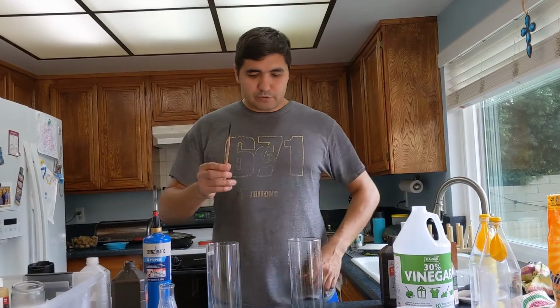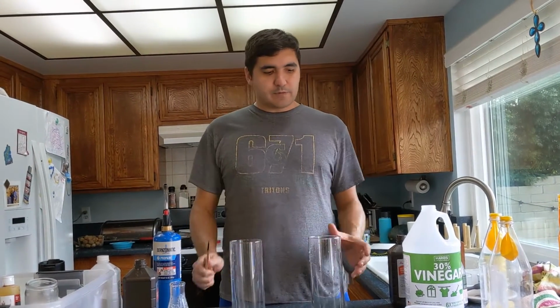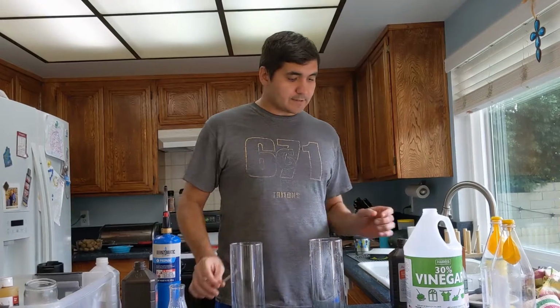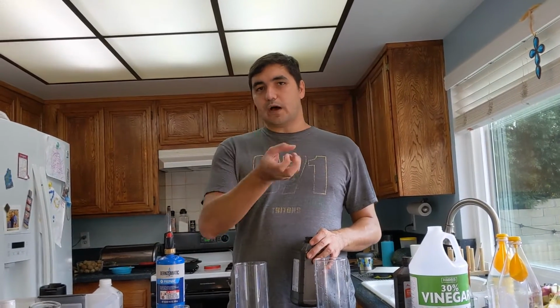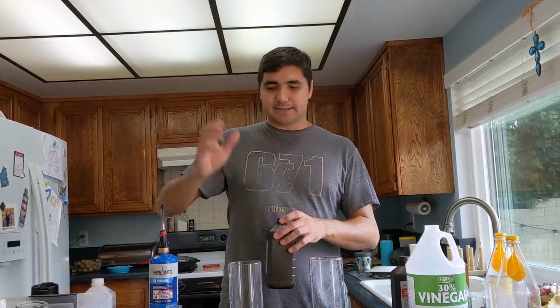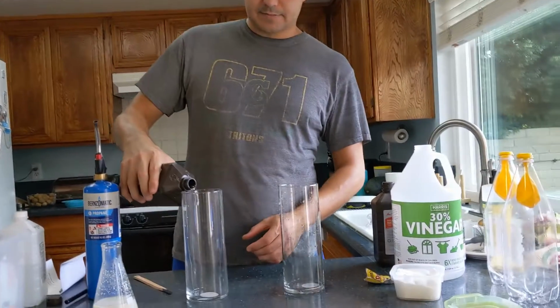What we're going to do is create two different gases. One of them is going to encourage this combustion process, and combustion requires oxygen. So it requires oxygen, fuel, and heat. And so what we're going to do is make some oxygen.